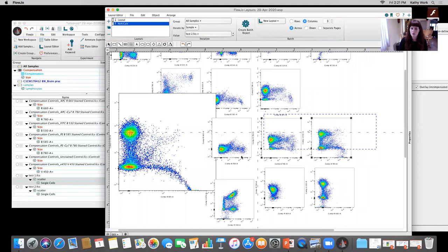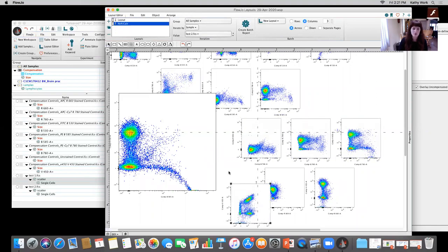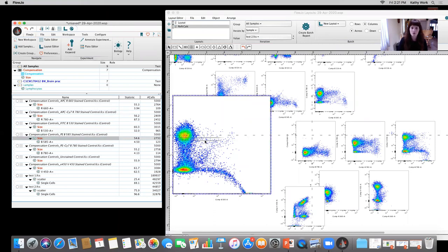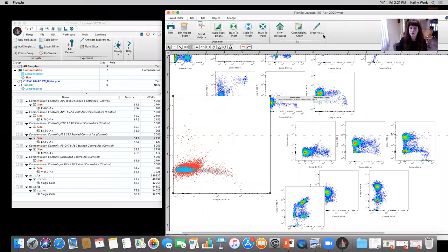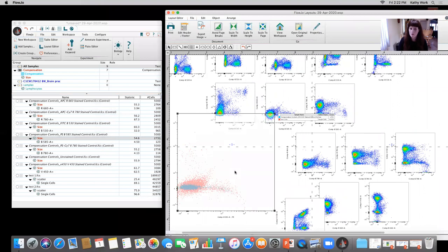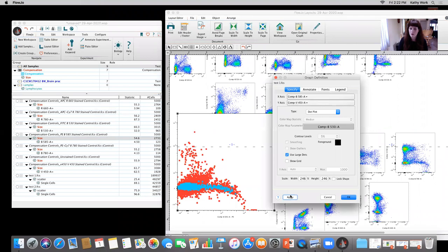Was it appropriate, right? So very clearly defined here that there's an issue there. I'm gonna go ahead and drag in this single color control that was for PE, okay? Because that's the detector. They used it off the blue laser, the 585 nanometer filter. I drag in this comp, should turn off iteration. And what I see here, it's a little bit hard to tell initially, but I'm gonna double click, use large dots, and apply. You start seeing the point where the sample is brighter than the single color. So that's one of our rules of compensation, right? We wanna make sure that our single color is as bright or brighter than the experimental sample.